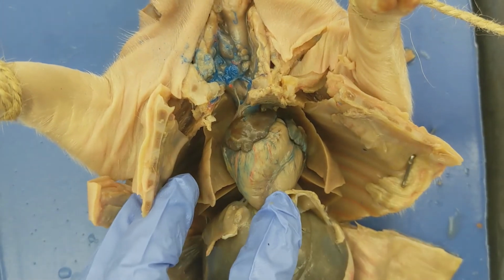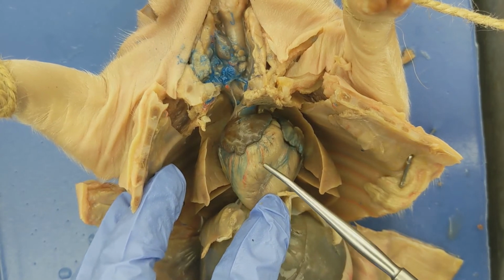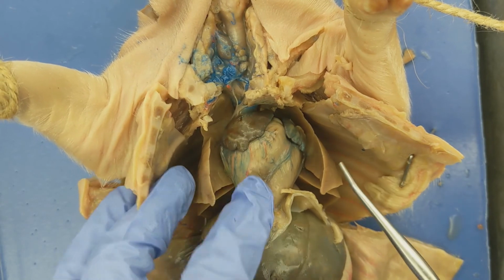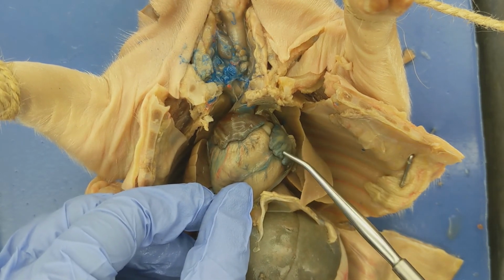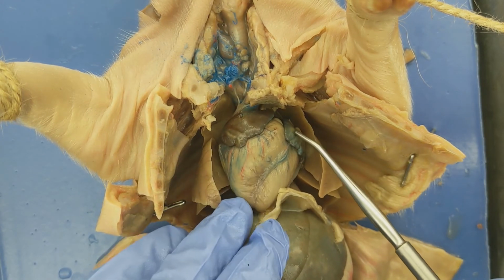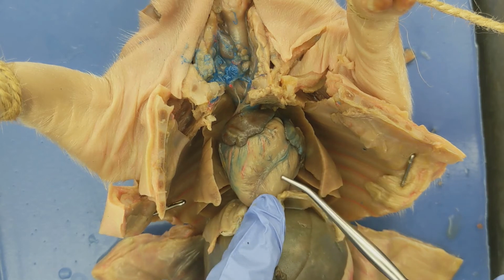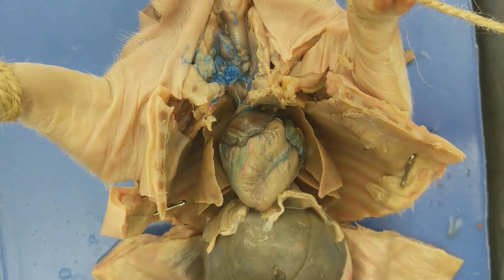compared to the atrium. From the right ventricle, blood then gets pumped to the pulmonary trunk, which will carry blood to the lungs. That's where the blood gets oxygenated. From the lungs, blood re-enters the heart into the left atrium, which you see up here. And then blood gets pumped from the left atrium to the left ventricle, which is down here. Once blood reaches the left ventricle, when the left ventricle contracts, that will push blood into the aorta, which will then pump blood throughout the body.